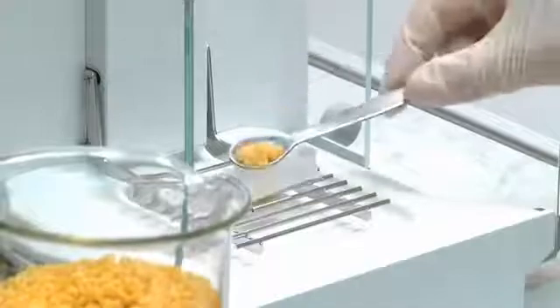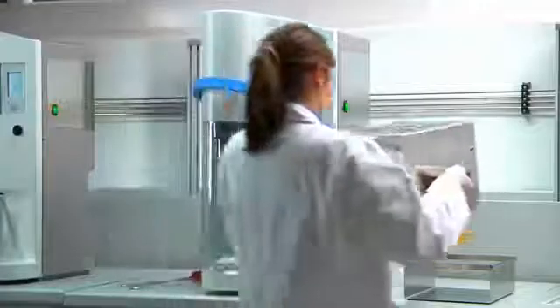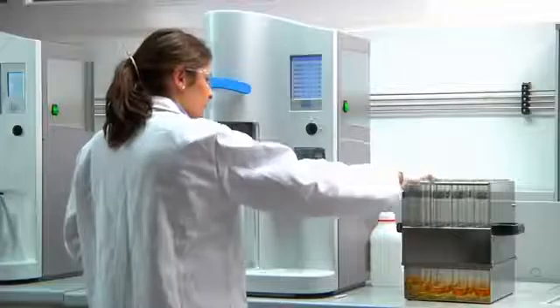Kjeldahl analysis is ideal for solid, semi-solid, and liquid samples. Homogenize the sample completely, weigh and transfer it into a VELP glass test tube as specified by the official method. Sample weight can be registered directly from the balance. Introducing sample tubes is simplicity itself.